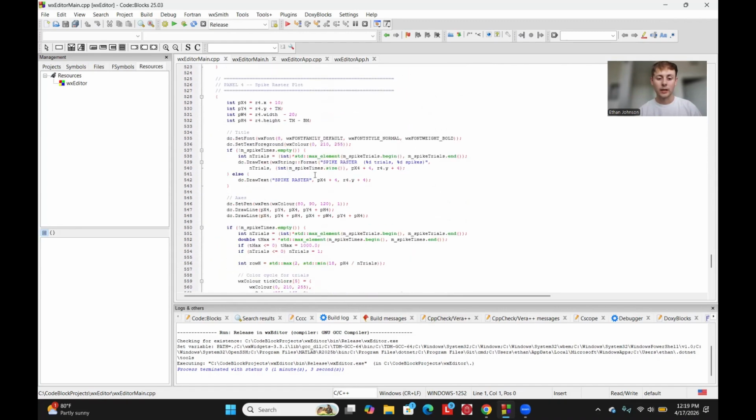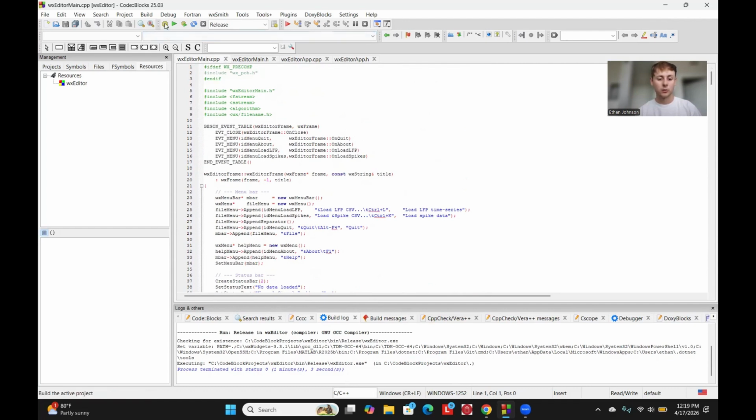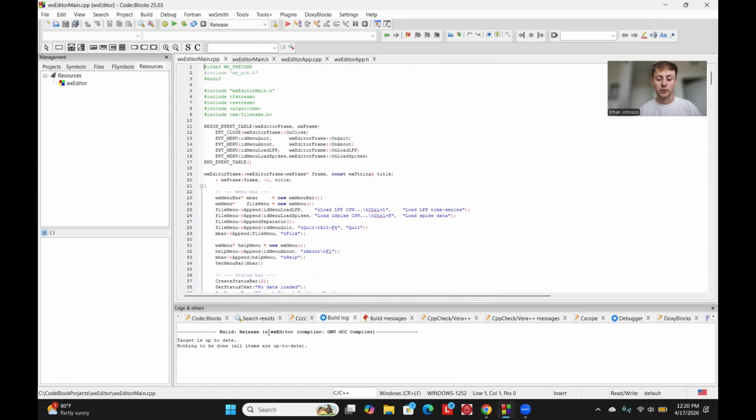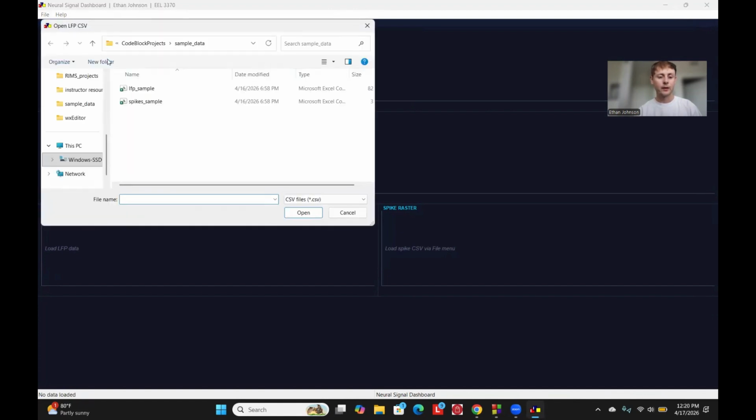So now I'll go ahead and talk about what this looks like. I just recently built it, so it's already up to date. Once you launch it, it will launch in full screen because this is the best way to see the figures. Then you can go up here to File and either load in your LFP CSV or the spike CSV. So we have a sample here. The CSV structure of the file just has to be in two columns.